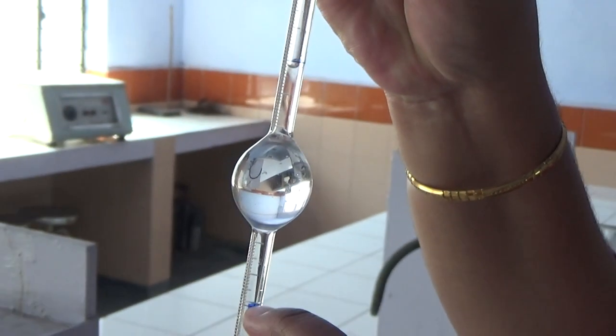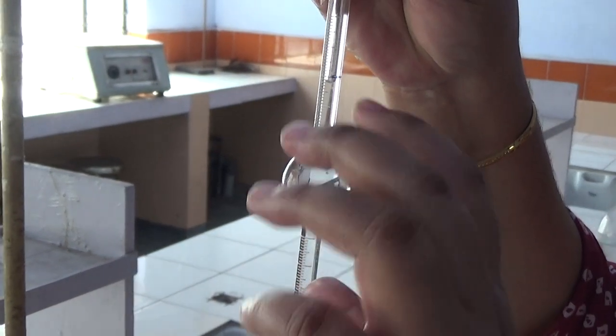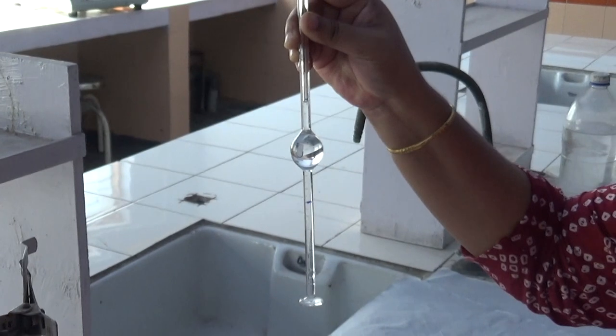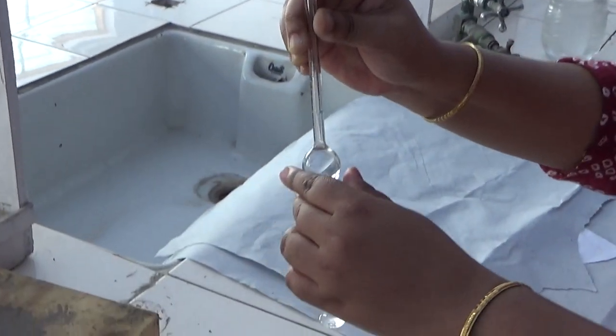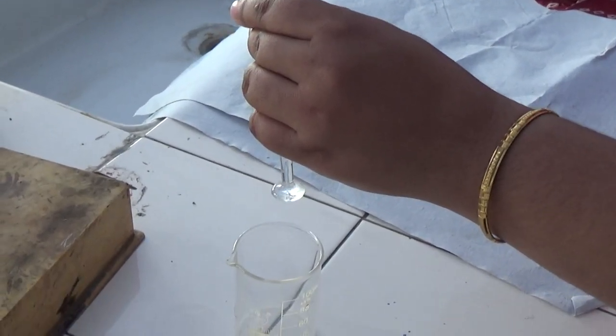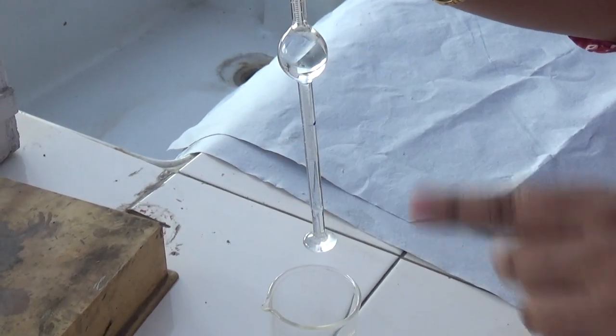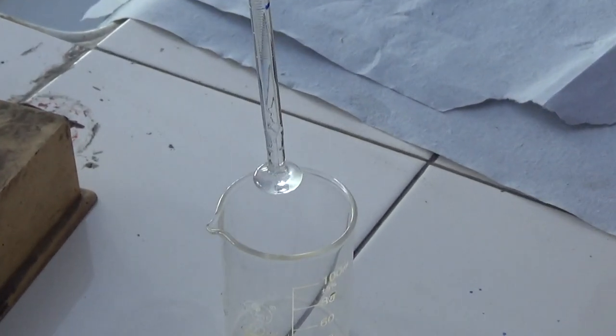Okay, as you can see, this is one mark A and this is another mark B. So, you have to suck the water drops from this point to this point, and you have to count the drops from A to B point. So, we will be starting counting the drops. You have to count the drops and it will give you the drops.